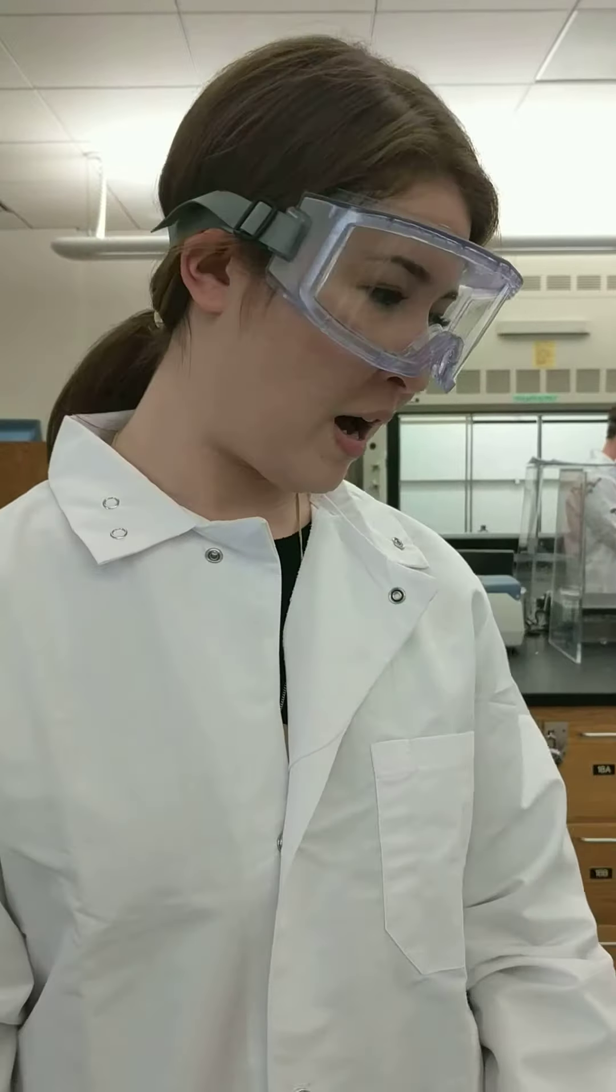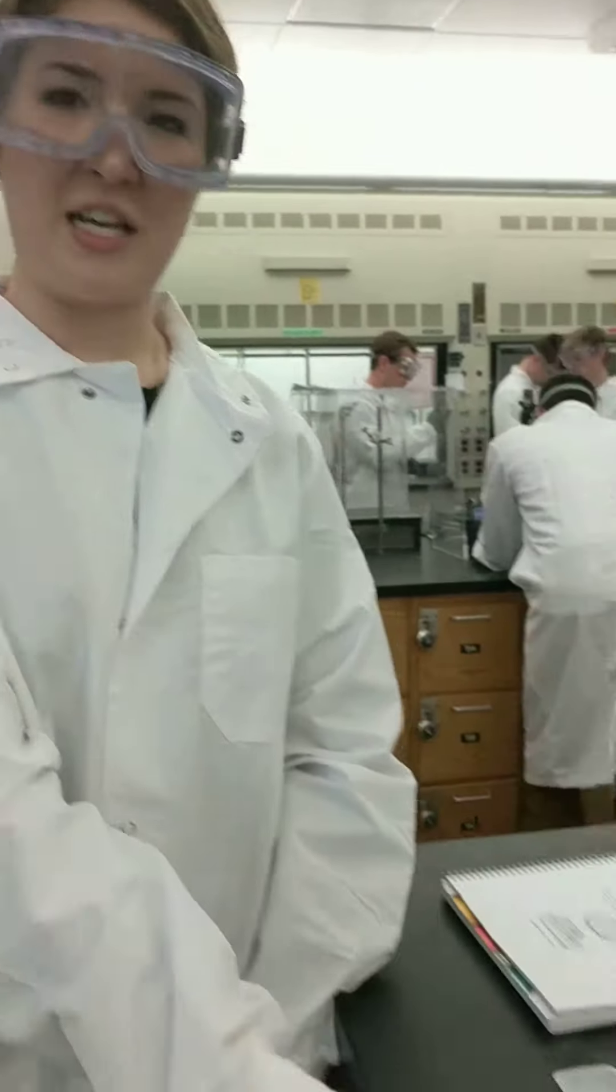I'm Ashley Stonley. I'm in Chem 107, Section 1. My TA is Brett, and today I'll be showing you how to measure mass using a scale.